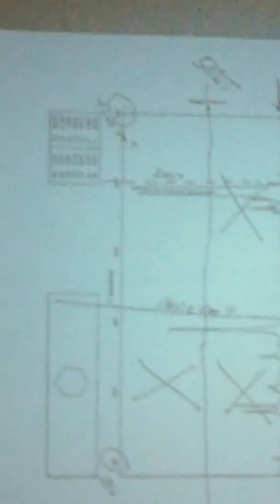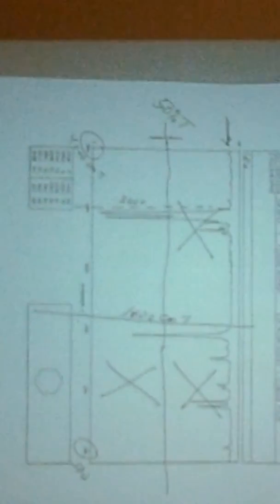So by virtue of that, it's not terribly helpful. You can assume that you're going to see saturated CH. So if I were to look at this spectrum, the only thing I see is saturated CH. So I'm going to conclude this is some type of saturated alkane or cycloalkane.